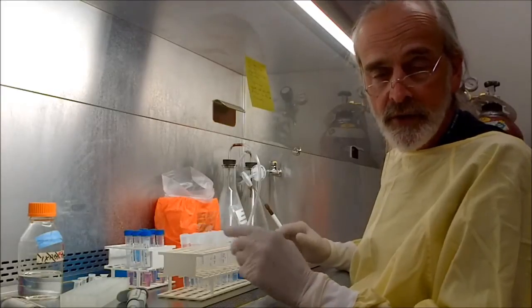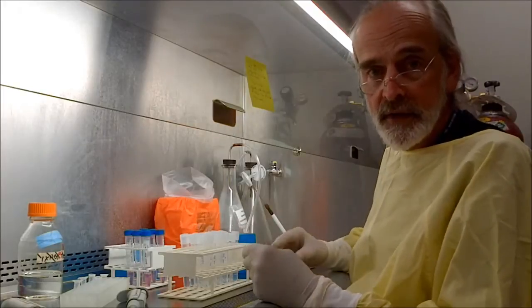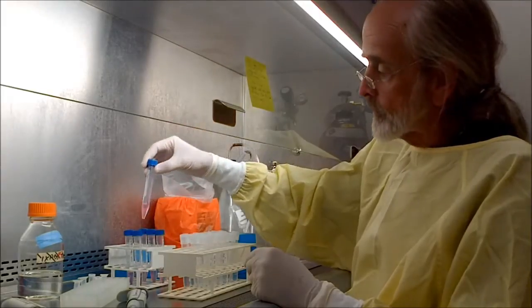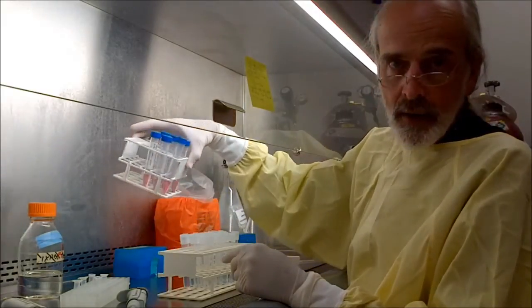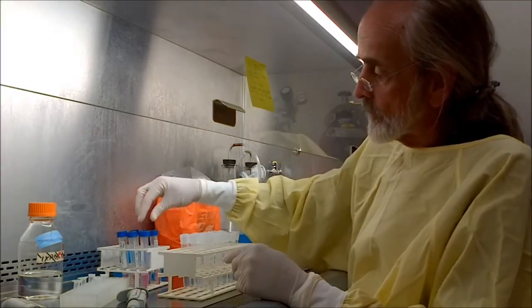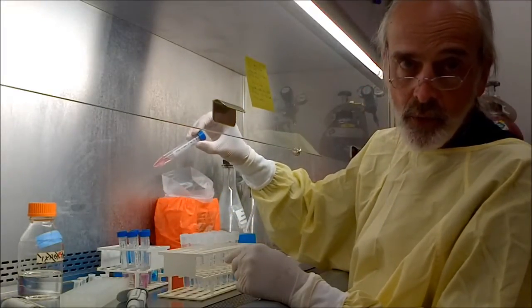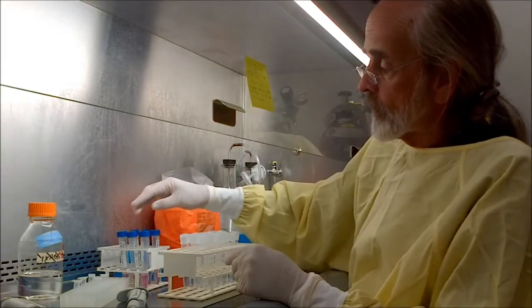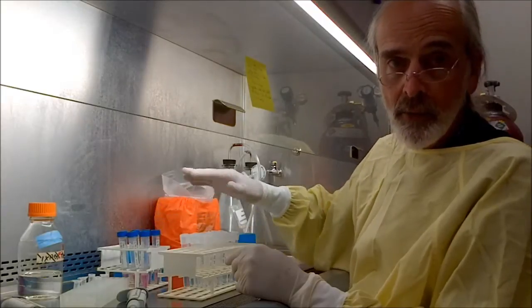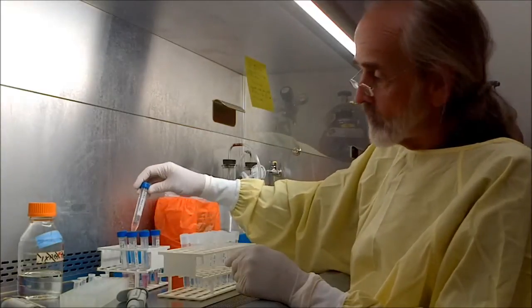And we let those infect the GCT cells for a while, and then we collected the GCT cells and put them into tubes like this. Each of these tubes, and there are 6 of them, represent a different time point. So for example, this tube represents GCT cells that were infected for 24 hours. So from 0 to 72 hours, or 3 days, we let the GCT be infected with the virus. Then we collect them into the tubes.